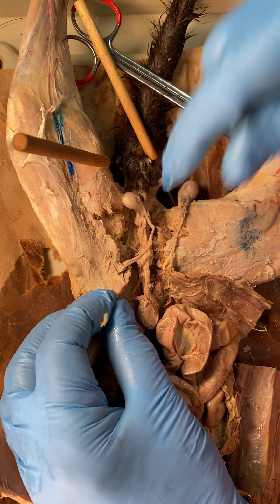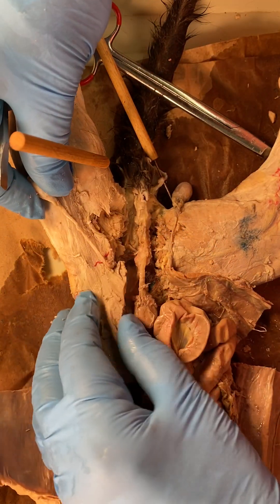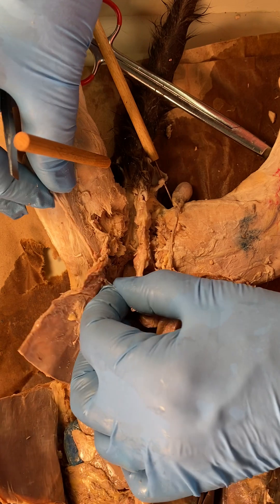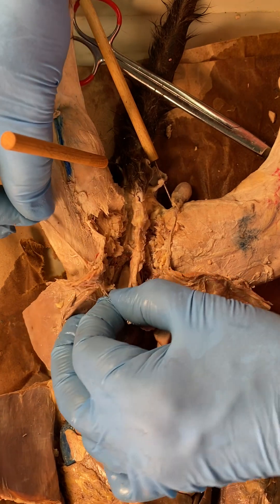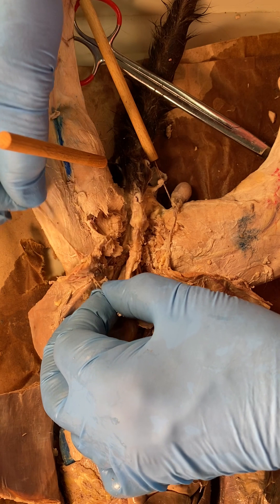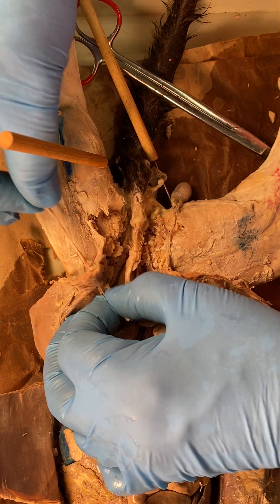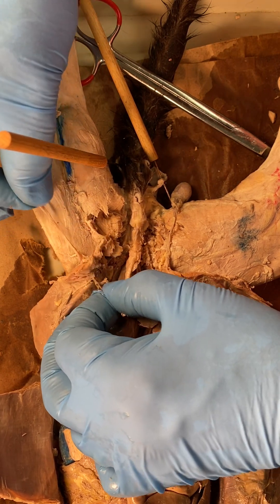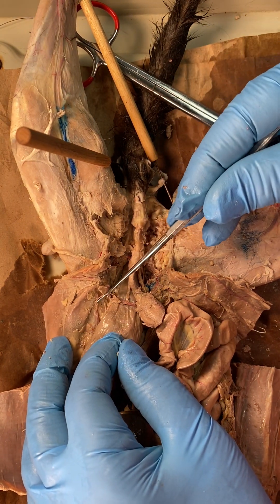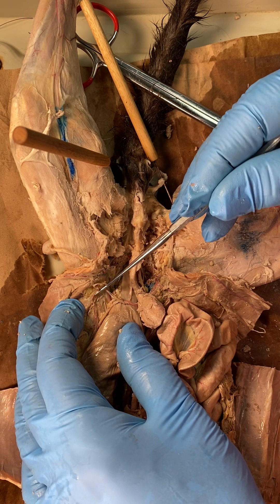On the left side, here's the left testes and the left spermatic cord, then the spermatic cord finding its way into the pelvic cavity through the inguinal canal. I was able to complete the same dissection on this side. You can see the vas deferens and the spermatic vein and artery moving through the inguinal canal.